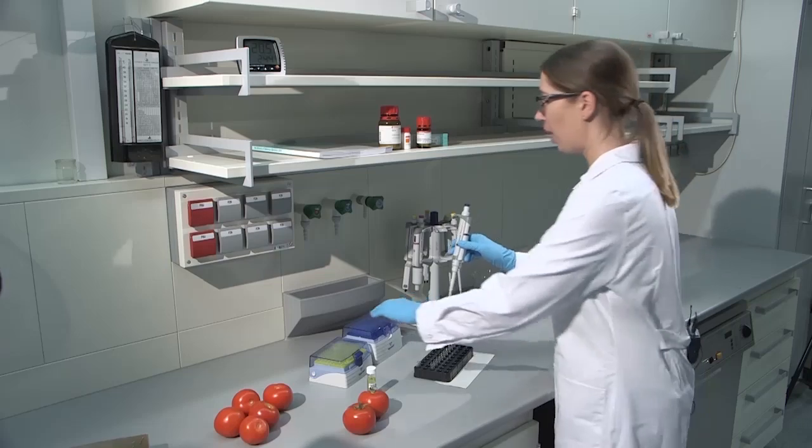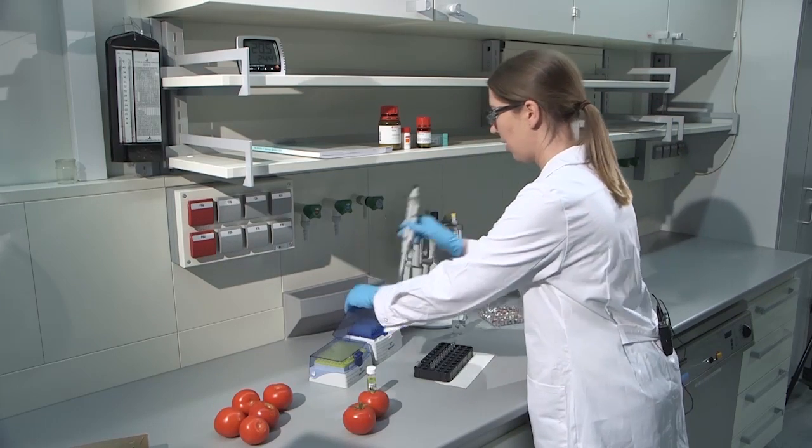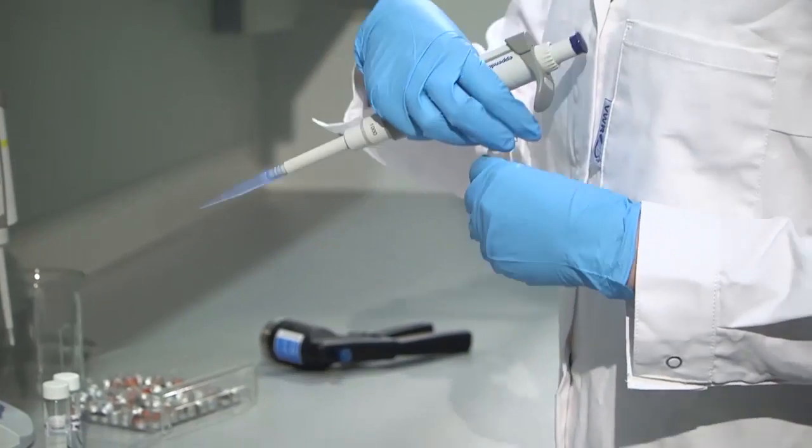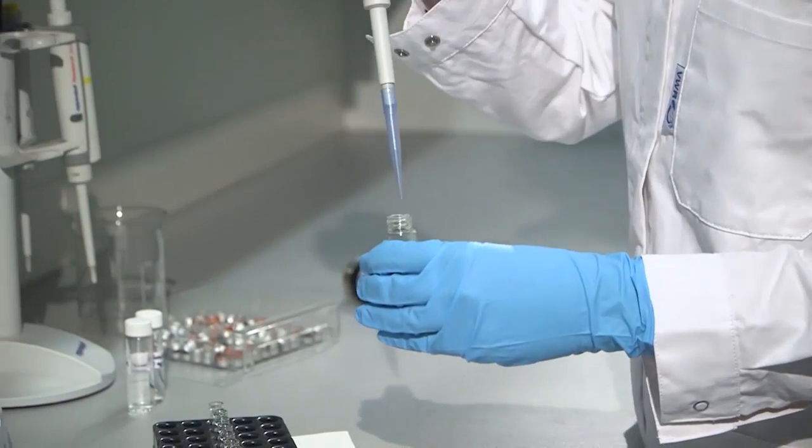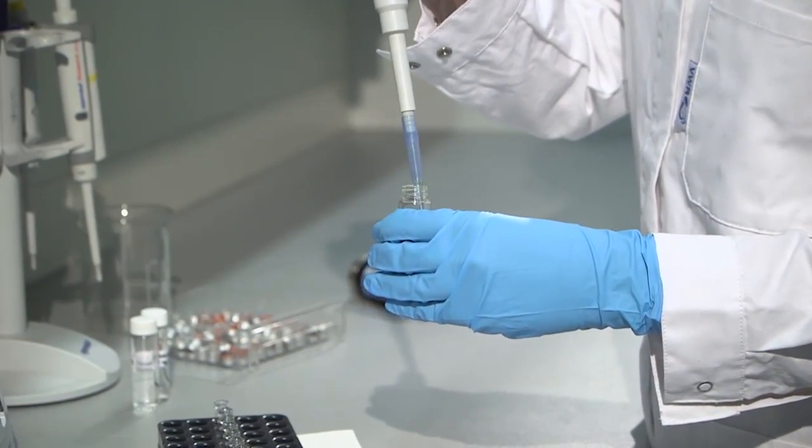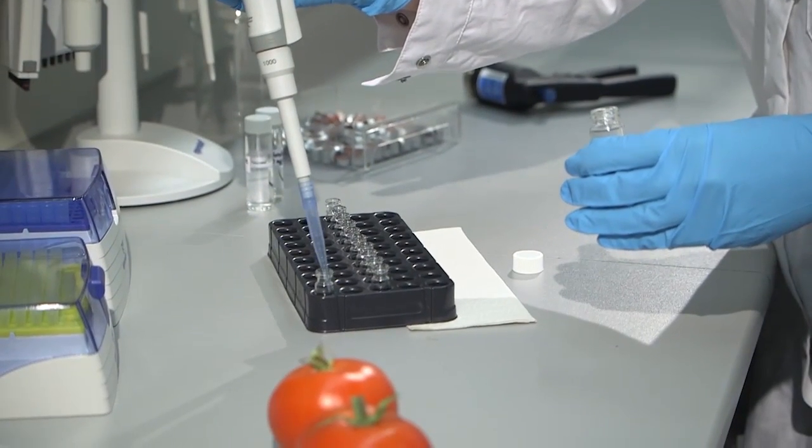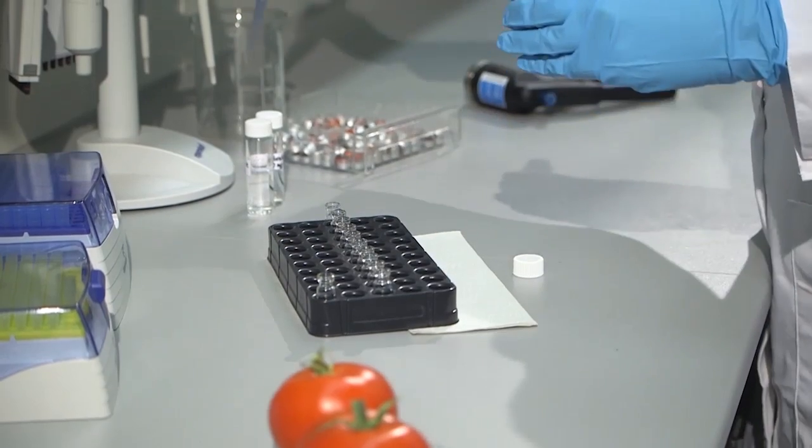First, I will be preparing the blank sample without any analyte added.